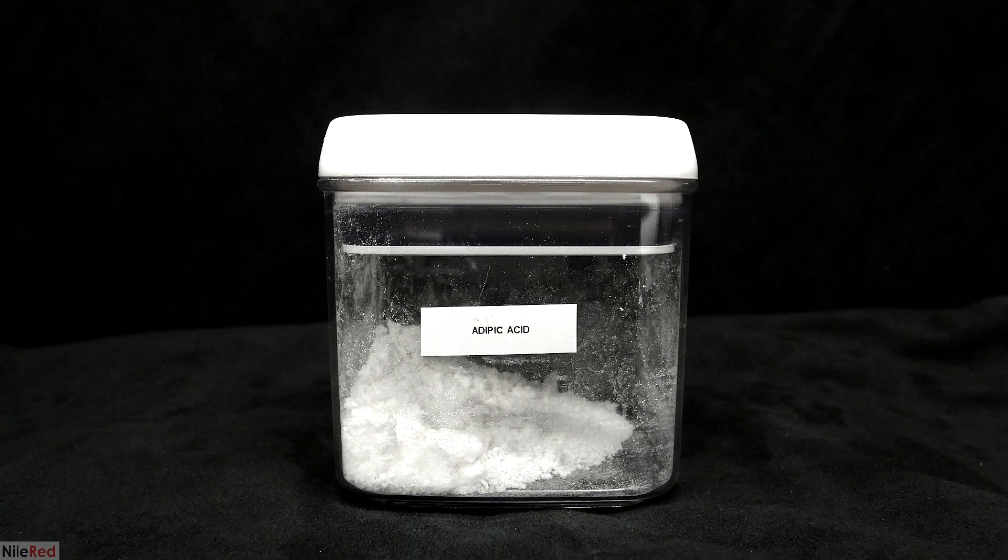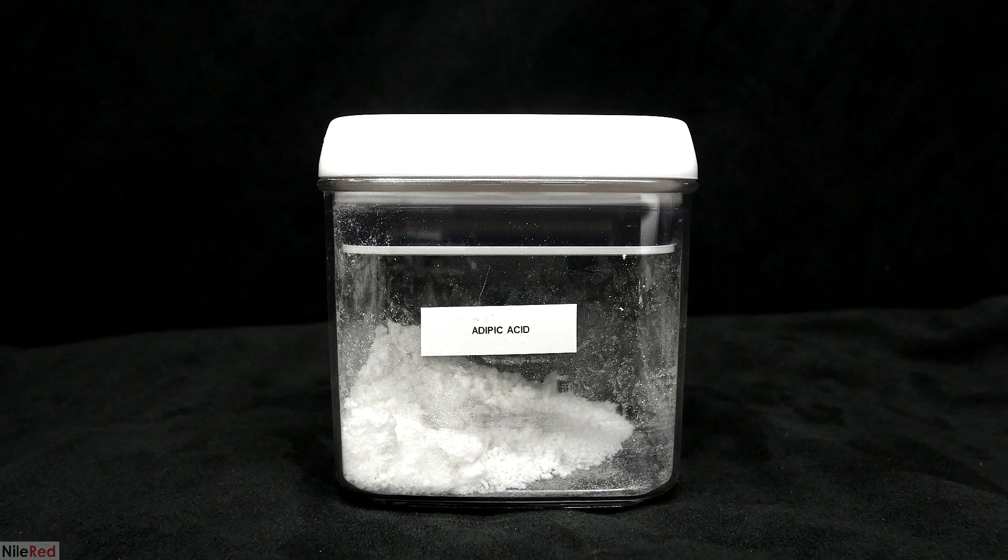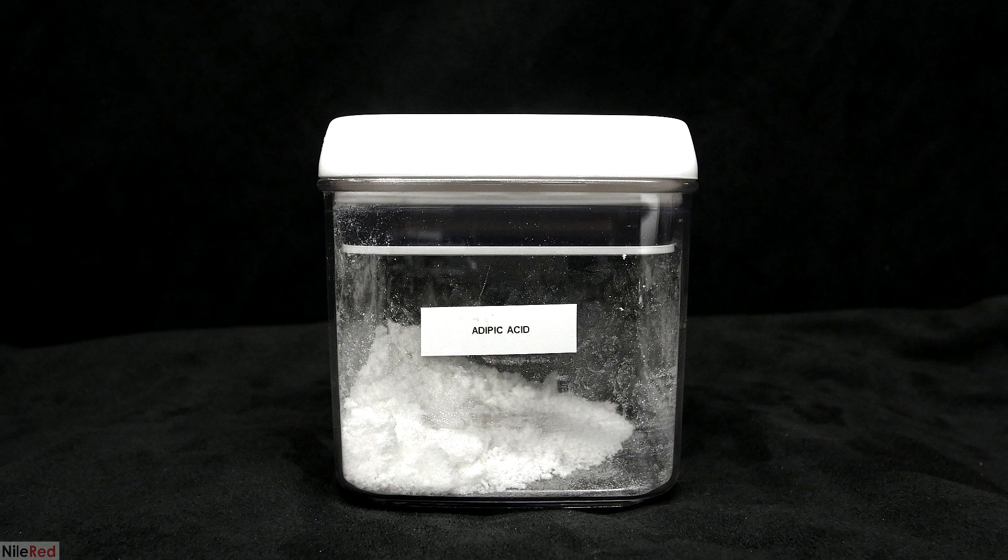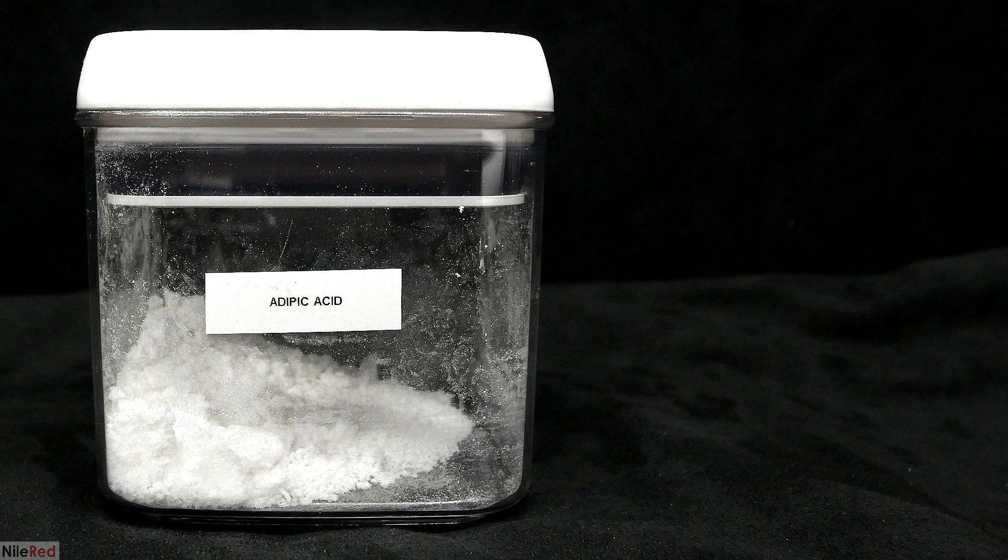The major reason seems to be really bad quality cyclohexanol. Pure cyclohexanol has a melting point around 26C, so it's pretty common for it to be solid at room temperature, which is around 20C. Well, the cyclohexanol that I have doesn't start to solidify below 26C, it starts to solidify below negative 3C. It was supposed to be pretty pure, but if it's not solidifying nearly 30C below the melting point, well, it's definitely pretty dirty.